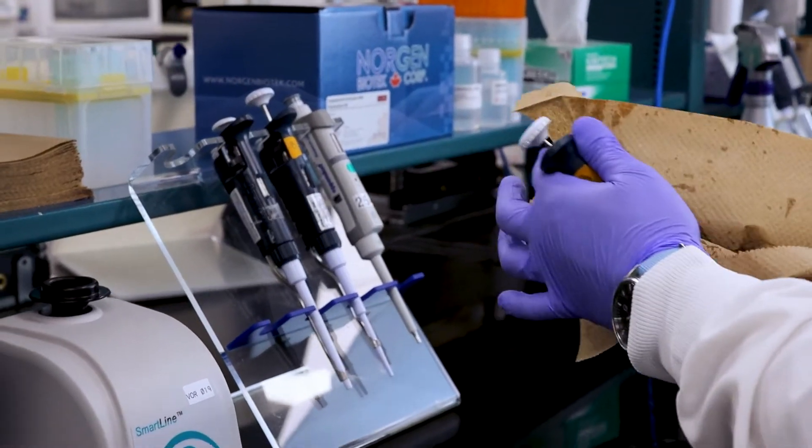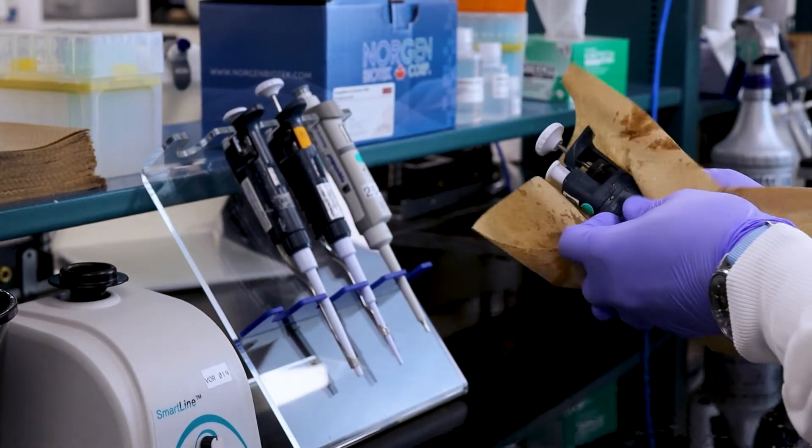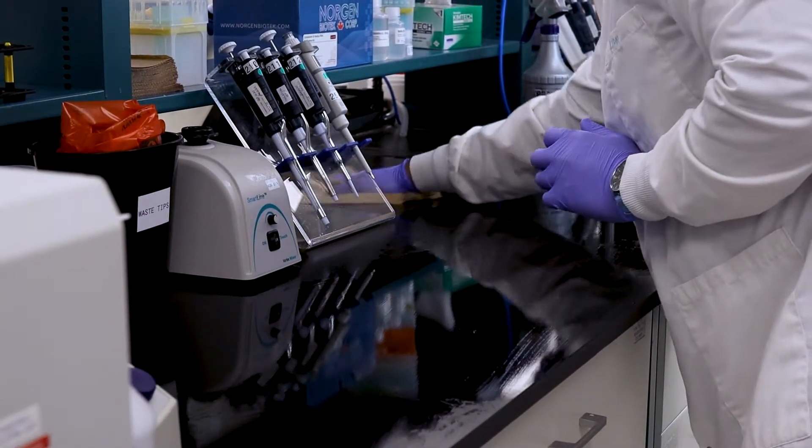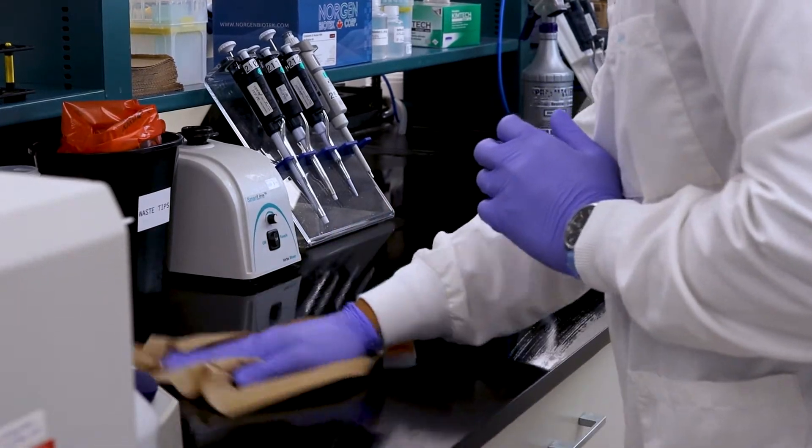To avoid contamination of samples, sterilization of your work area and instruments using 1% bleach followed by wiping down with 70% ethanol is recommended prior to starting.